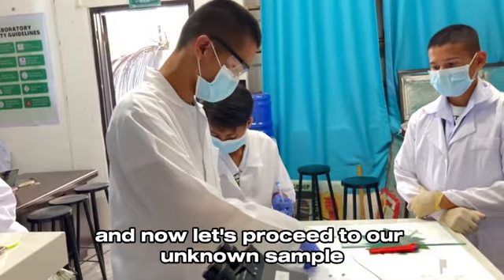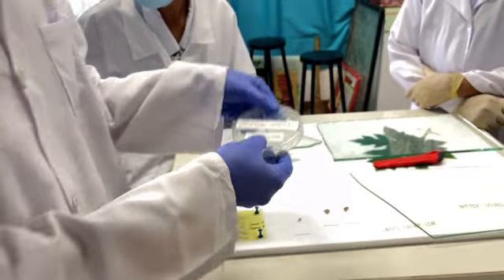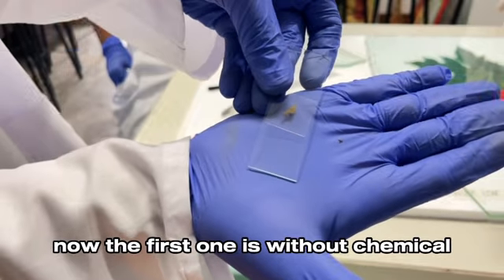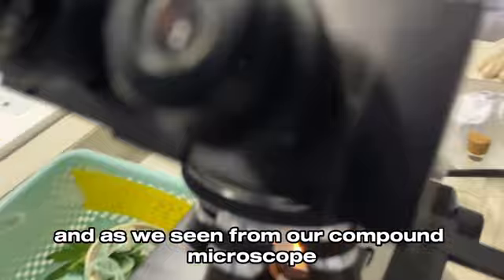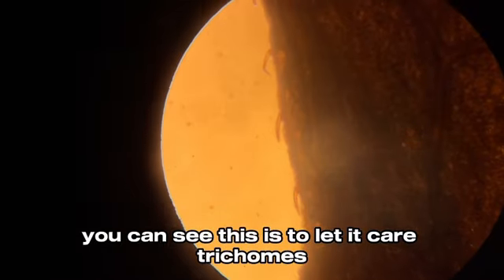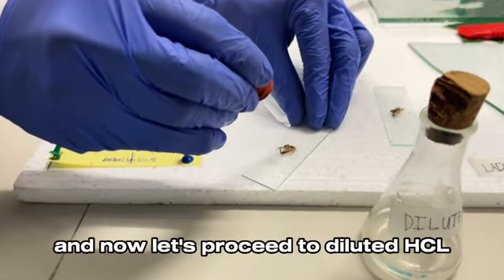And now, let's proceed to our unknown sample. The first one is without chemical. As we see in our compound microscope, we can see the cystolithic hair trichomes. And now let's proceed to diluted HCl.